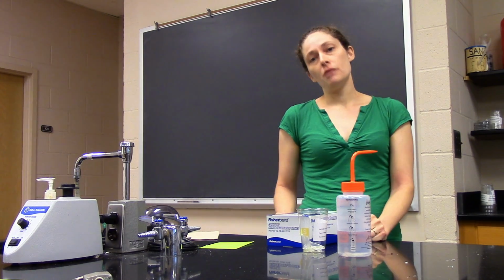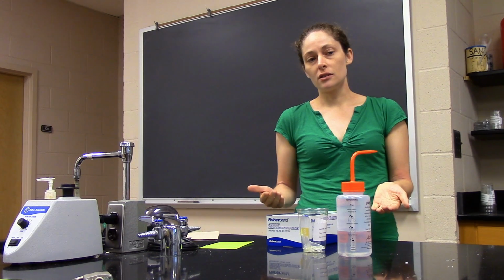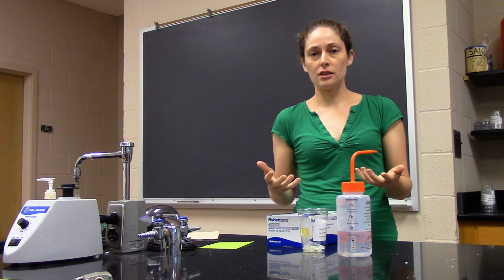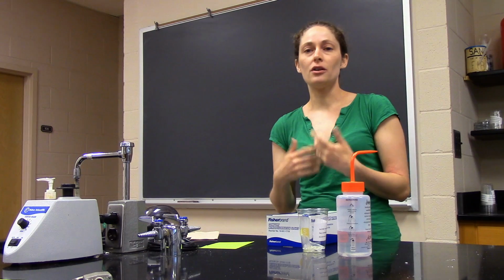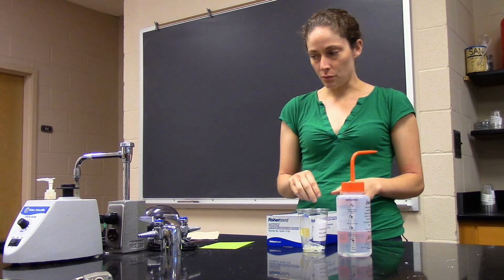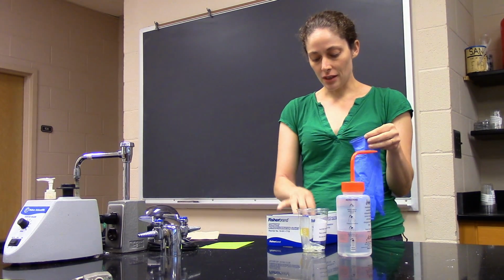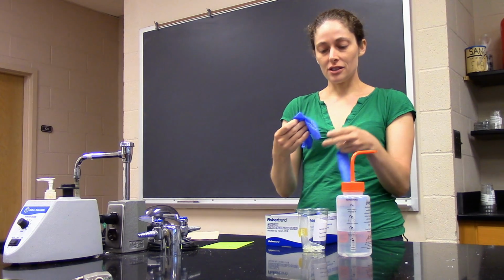All right, so how do we minimize chances of contamination? I'm just going to go over general techniques today. In certain cases, you'll want to use additional sterile techniques. But basic lab practices would be to wash your hands when you come into lab, put gloves on, and even something this simple, there's a technique for it.